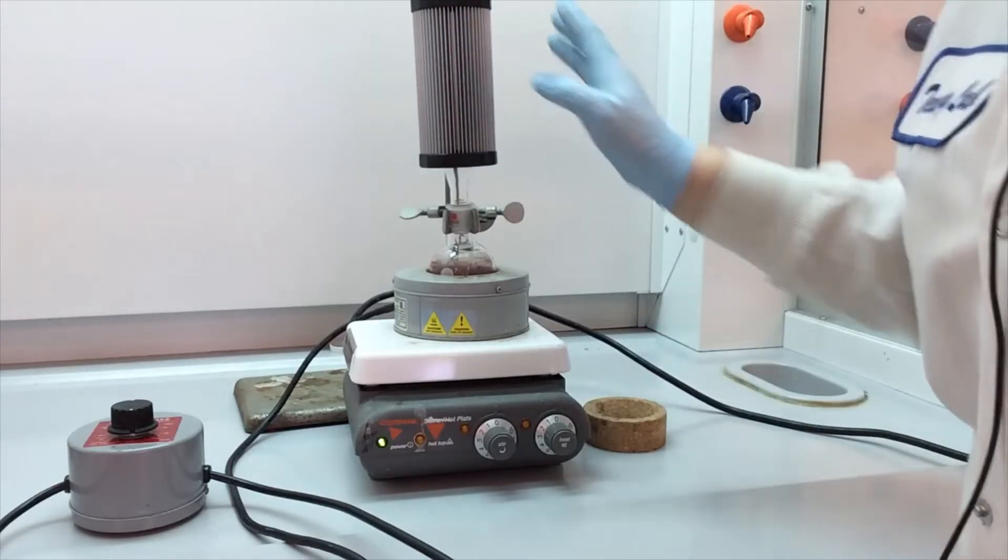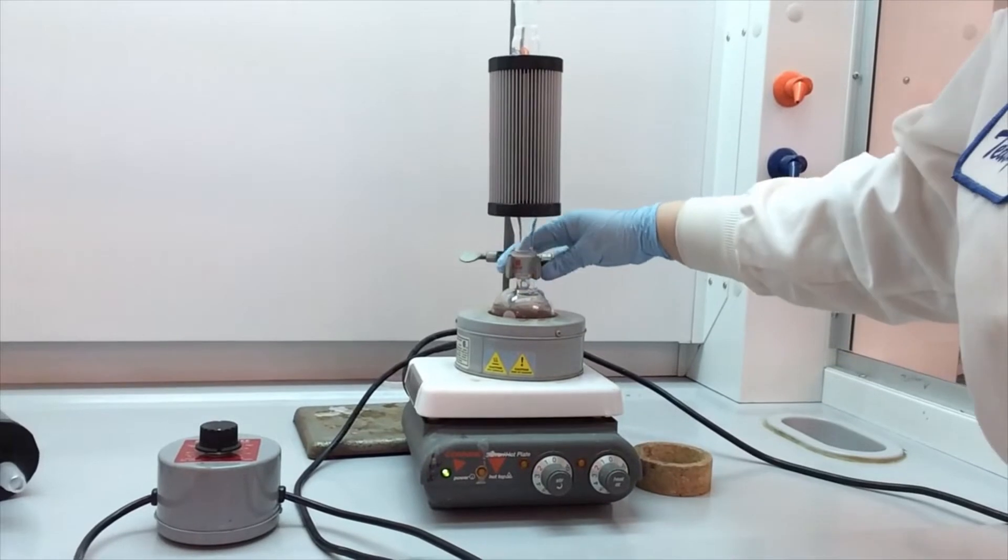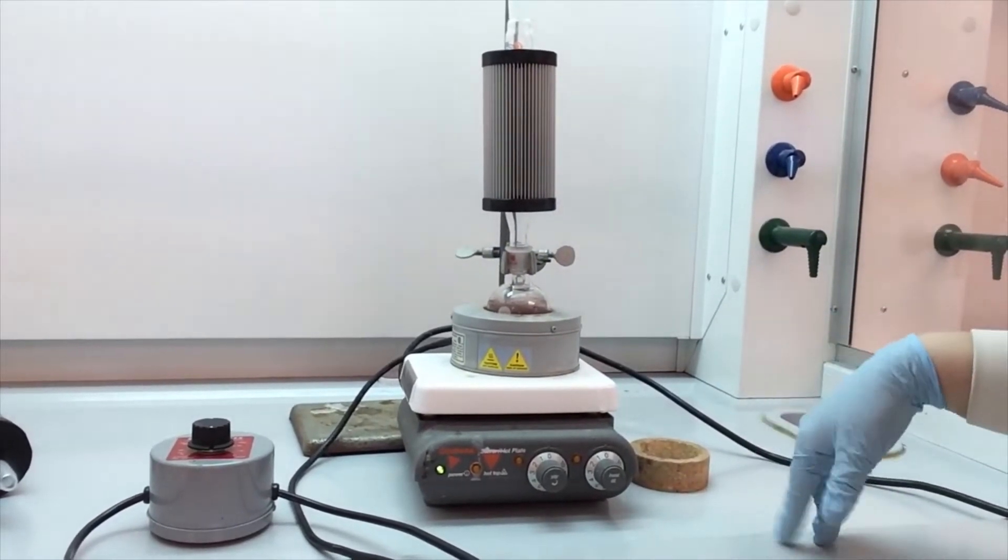So we can just put our condenser right on top. This is nice and secure. That's the only clamp we need.